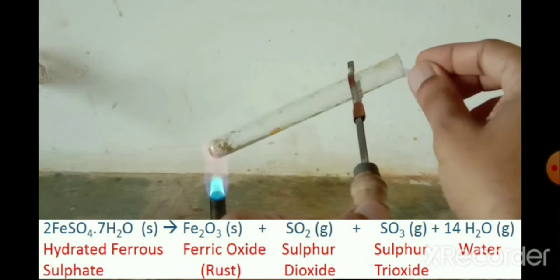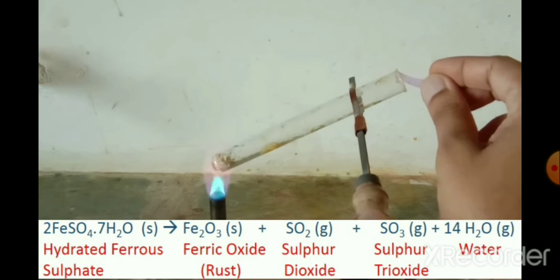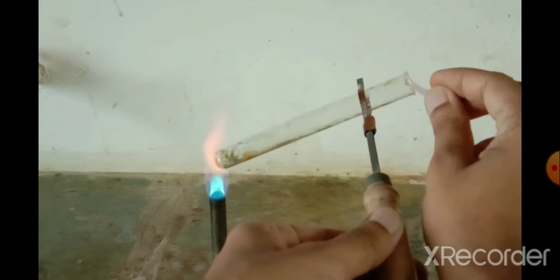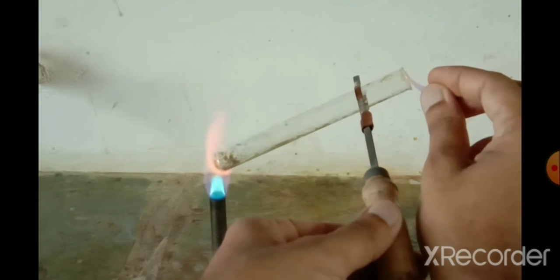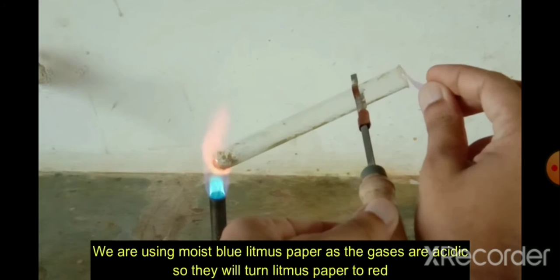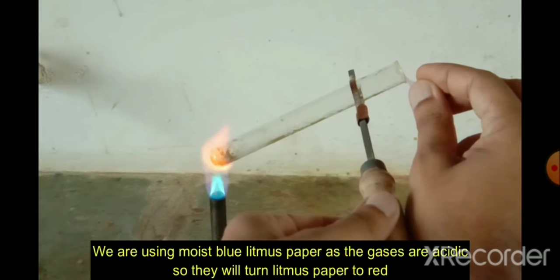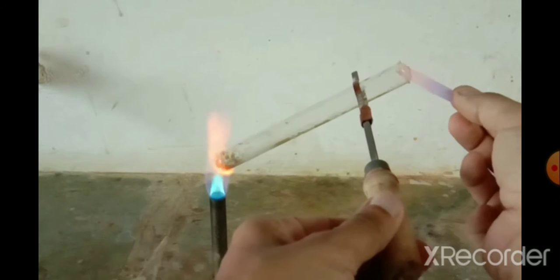Now we have dipped one blue litmus paper in water, and we are putting it at the mouth of the test tube. We will see that this blue litmus will change to red color because sulfur dioxide and sulfur trioxide gases are acidic in nature, so they will turn it to red color. And the brown colored Fe2O3, that is ferric oxide, will be formed, or we can say rust.